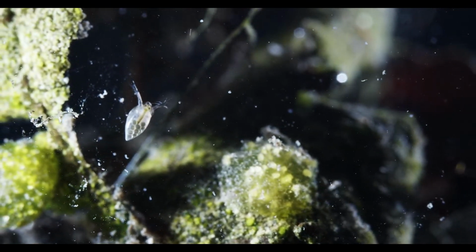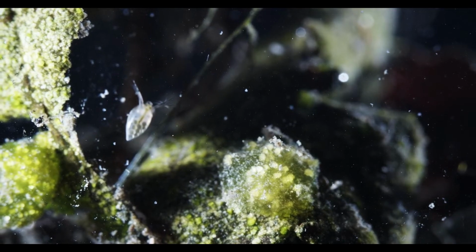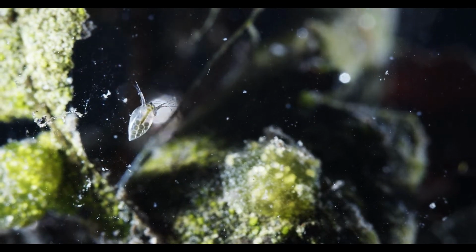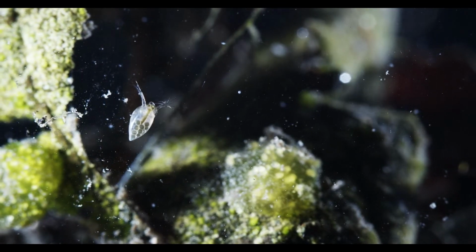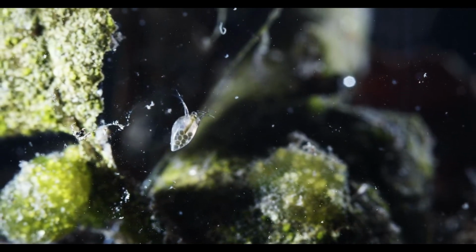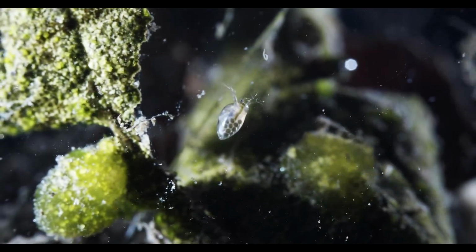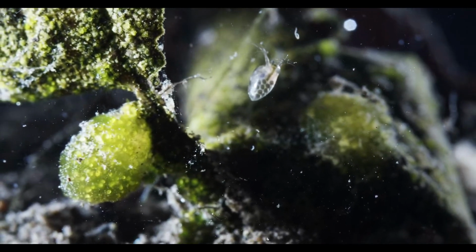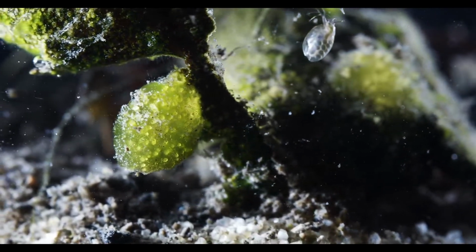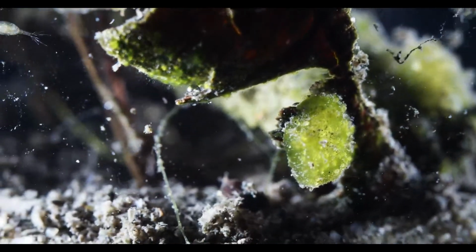And in my book, there's almost a dozen different kinds of water fleas. Some are even predatory. So even if you are able to identify something as a water flea, it doesn't necessarily mean that it is the water flea you want.